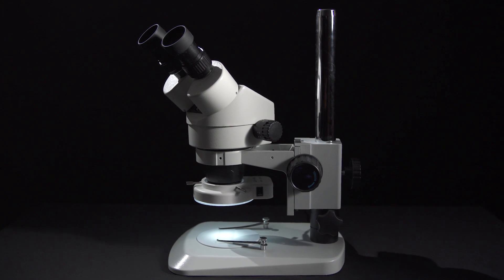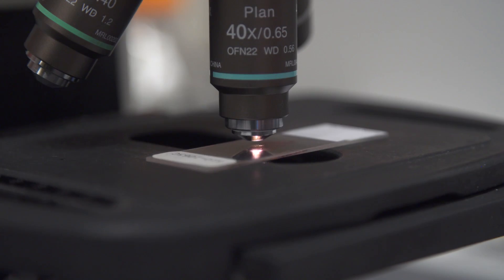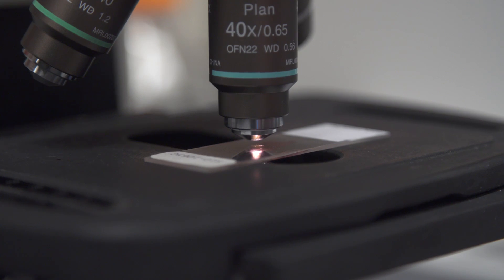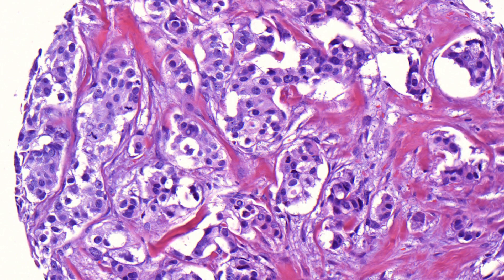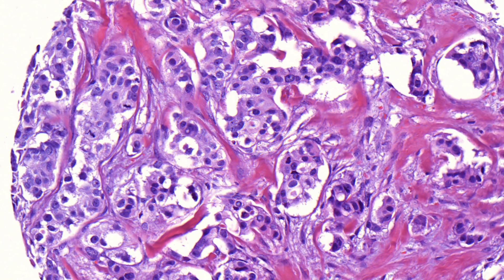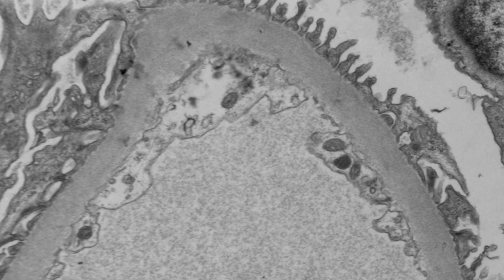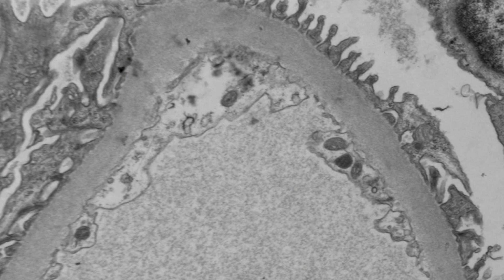For hundreds of years, the way you imaged biological things is you would take a piece of glass called a lens, and it would magnify the rays of light from a specimen, so you could see bacteria, brain cells, or cancer cells. But there's a problem — light has a finite size or wavelength, and there are certain things you just can't see. You can only see them with electron microscopy, but that's expensive, painstaking, and slow.